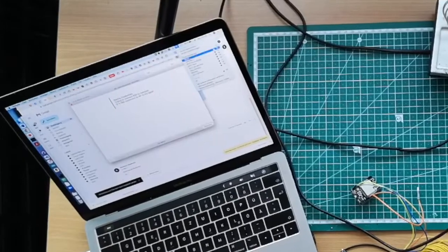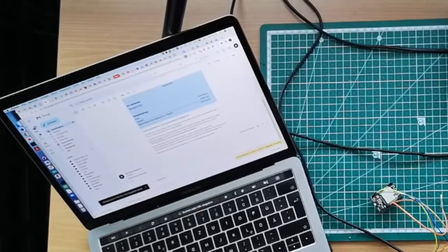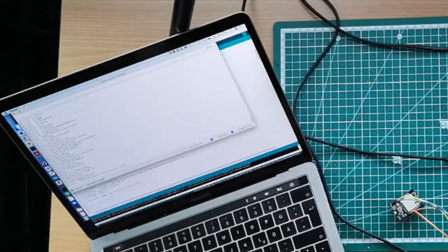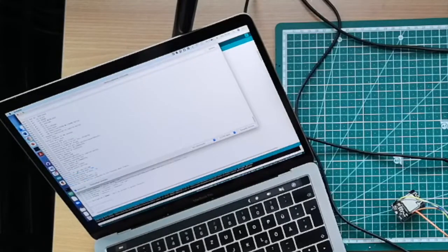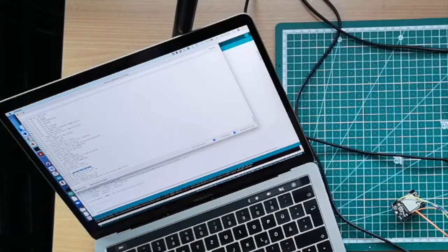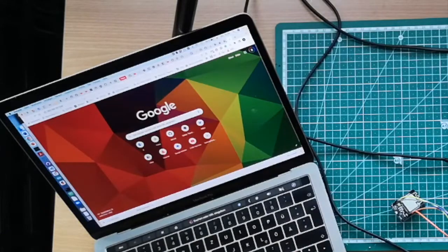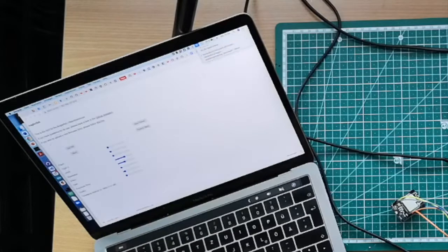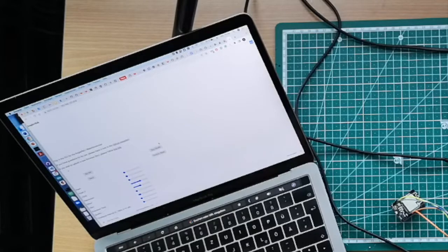So I'll do that also with my laptop. And then you'll see in the serial prompt that there is something connecting to the Blink network. You just copy paste the IP address, or the right fraction of it, and then it should work. So now I'm connected to Blink, the Anglerfish software is opening, and then you can, for example, start the stream, where the camera will then start streaming.